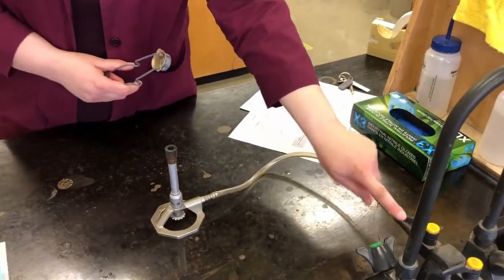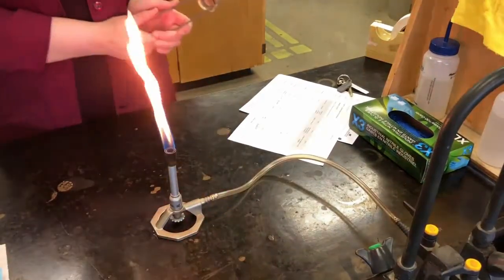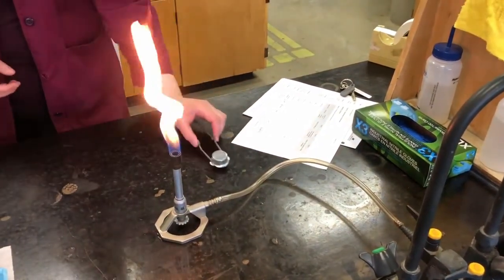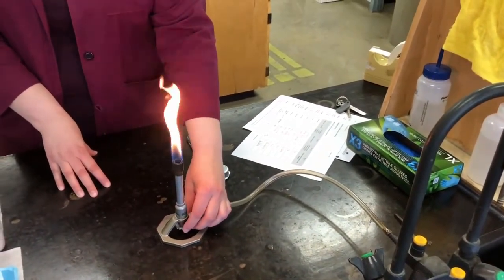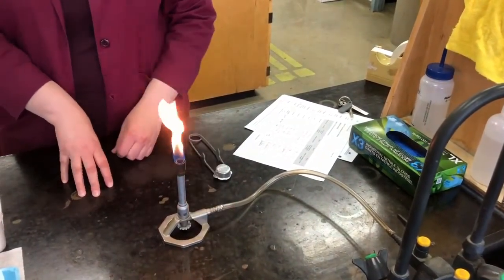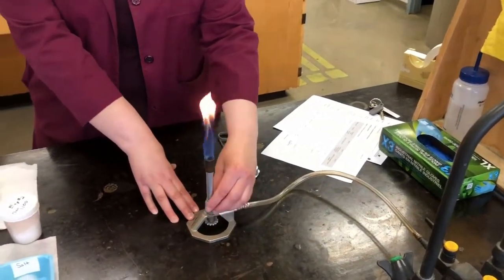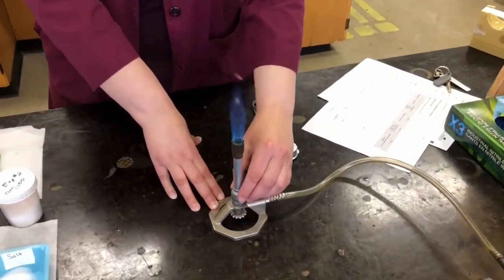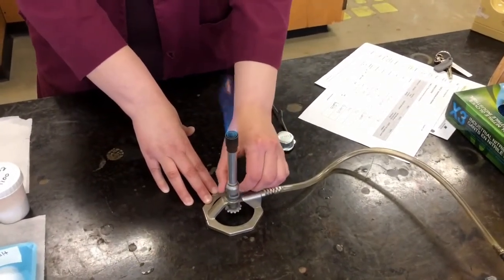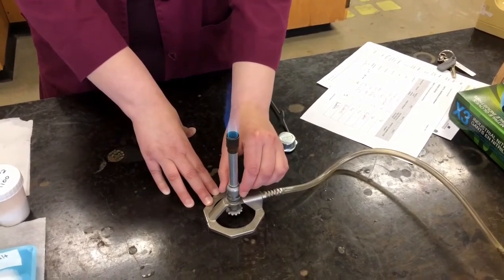We're opening our gas valve so that it's parallel to the hose. And there we go, our flame is lit. It's a little high, so I'm going to turn it down a little bit. To adjust the height of the flame, we use the gas control valve. And if you remember again from our first video, the most effective flame for heating is a mainly blue flame with just a flicker of yellow at the tip.